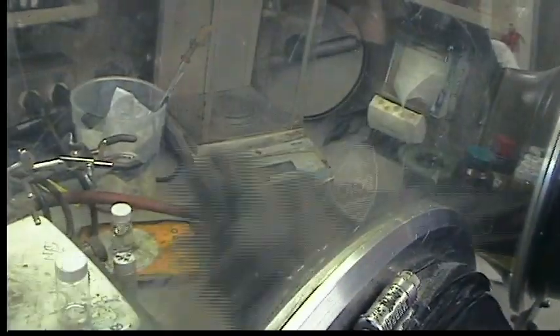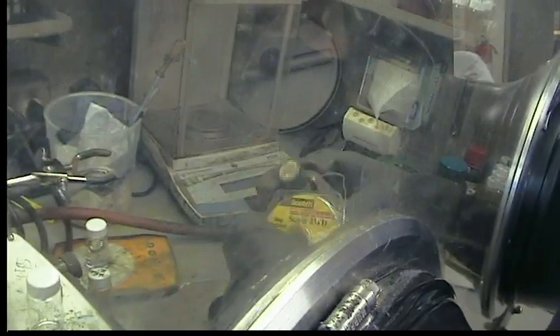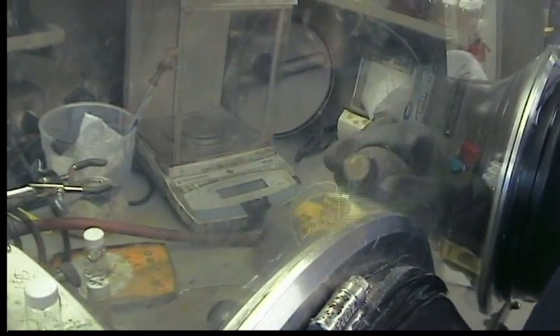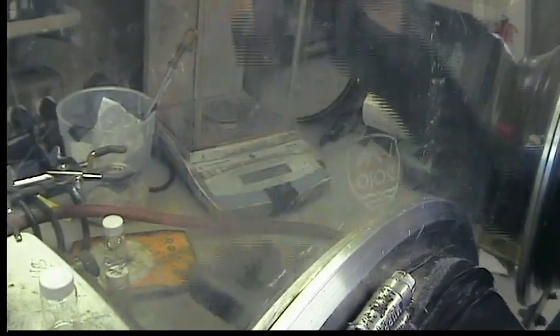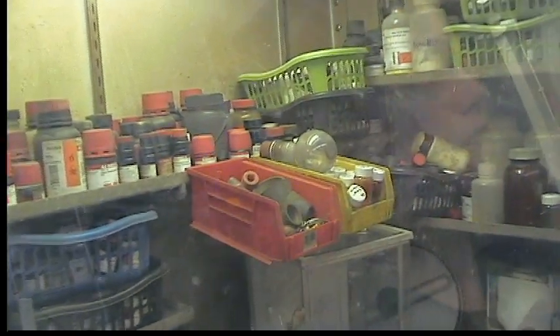Is the catalyst port closed? Yes, the catalyst is closed — when we use these volatile chloride-containing species that might react with the copper, you definitely want your catalyst closed, especially with arsenic trichloride. Before you purge, you want to drop the cold well so that anything condensed there will evaporate. We always seal it with tape, and it's stored in a bottle kept out of the light at room temperature.